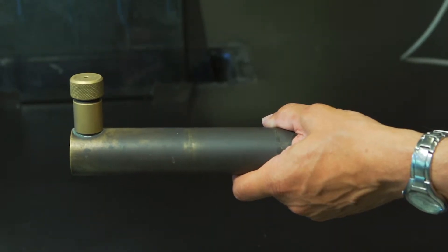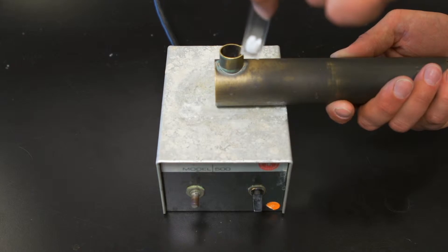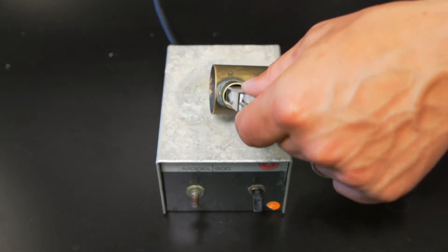Here's the cell compartment. Inside is a cuvette and a stir bar. The stir plate is placed underneath the cell compartment to enable the stirring.